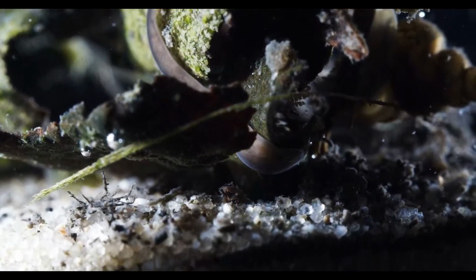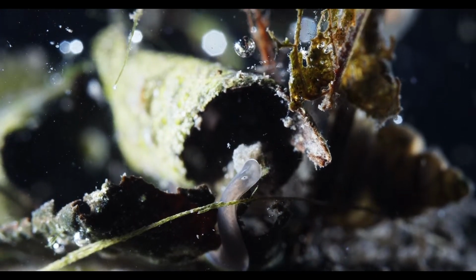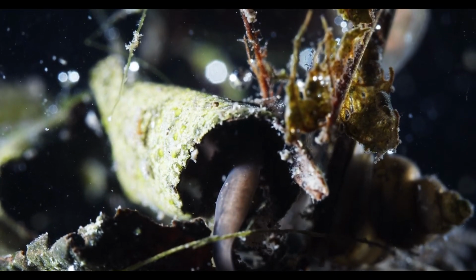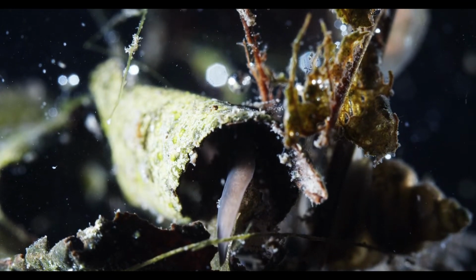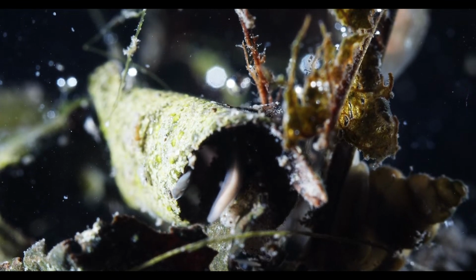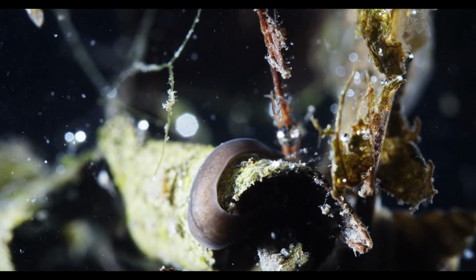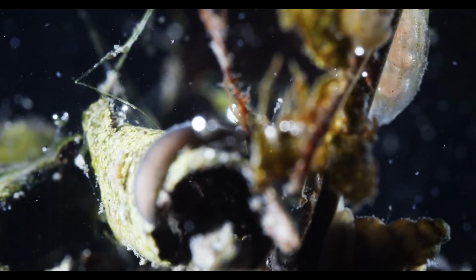What's this planarian up to? Ooh, with the eye spots. So I think this is Planaria torva. And I think I mentioned it before I started the stream, some of these flatworms don't have these eye spots on the top, but they have kind of a row of eyes, the whole front edge of their body is lined with eyes, which is really kind of cool.